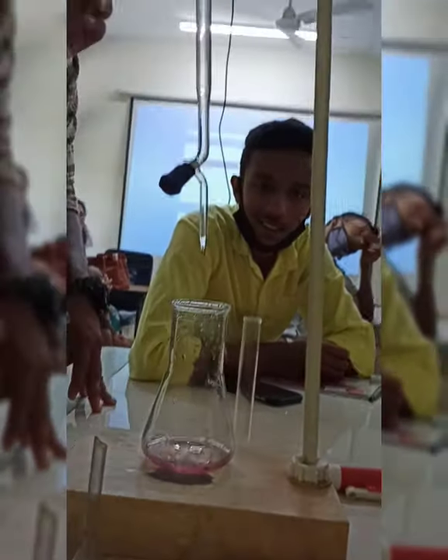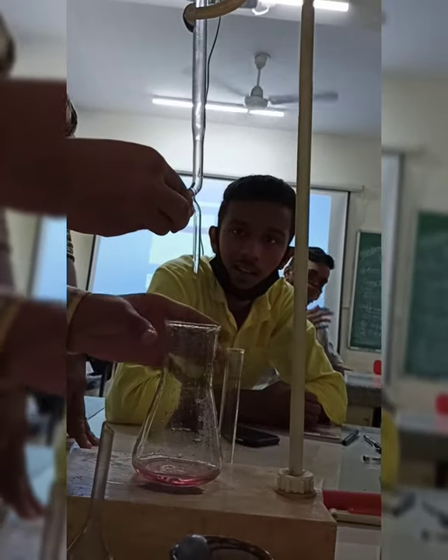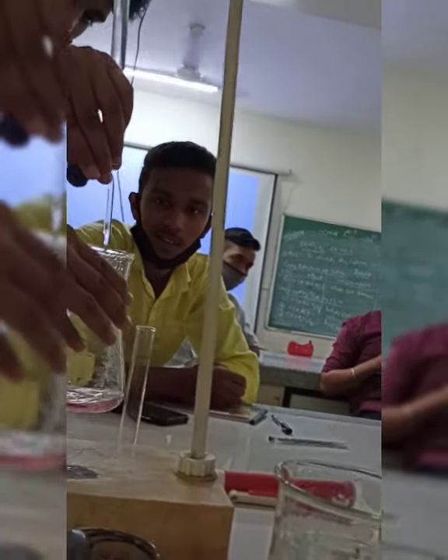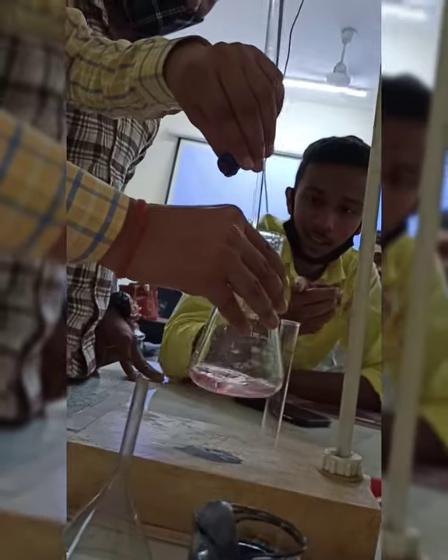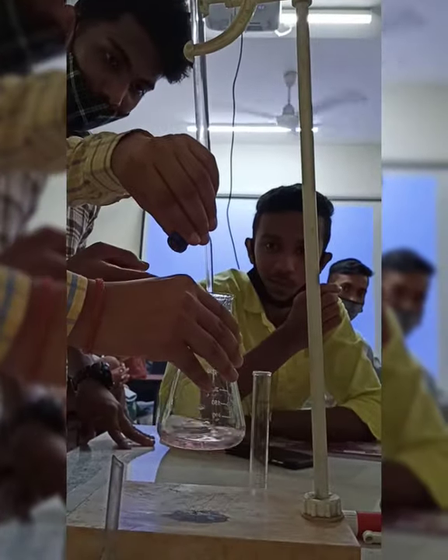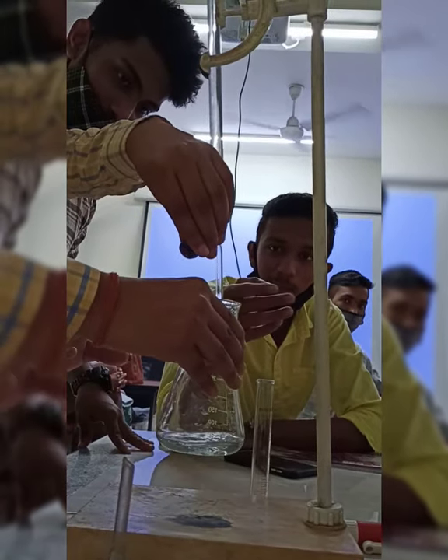We will keep the flask under the burette, which is filled with EDTA. Now we will gradually stir the Erlenmeyer flask containing the unknown sample of hard water. We will wait until it turns blue in color. And finally we have got it — it is blue.